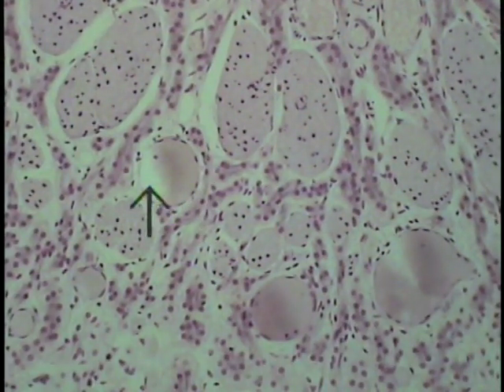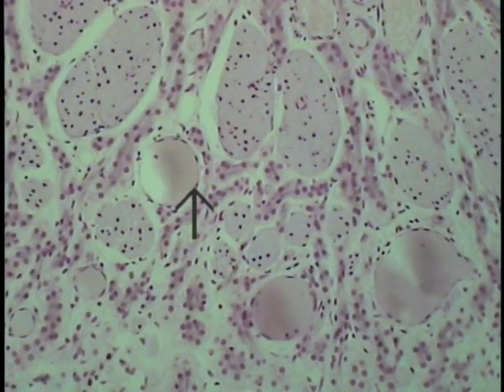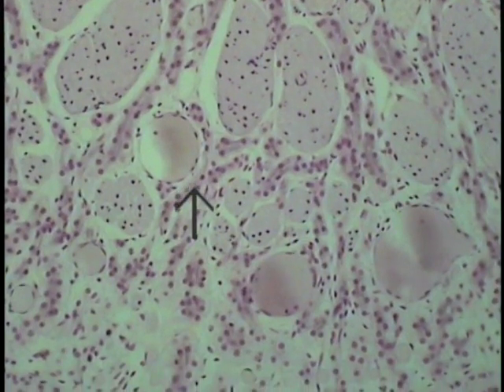These structures here are the venous sinuses in this surrounding lamina propria, so one can observe that the lamina propria underneath the olfactory epithelium is filled with a variety of structures, resulting in the considerable depth that this region achieves.